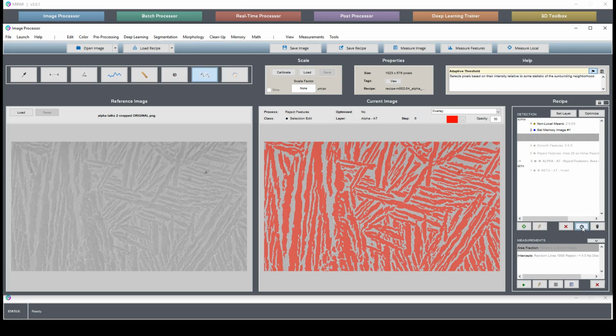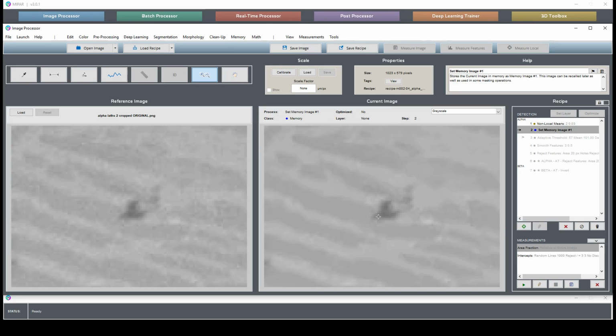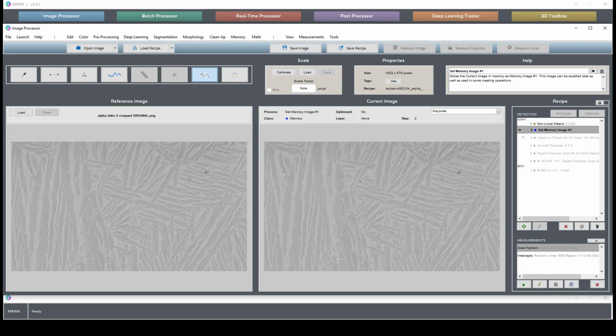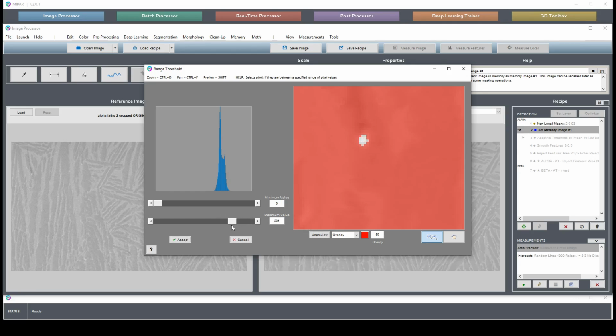So to accomplish this, we'll start with our noise reduced image and select these dark and bright features. The simplest way to do that here, because we want both dark and bright, is to do a range threshold where I select all the stuff in the middle and then just invert. It takes less processing time to do that one range threshold rather than a bright threshold added to a dark threshold. Much easier to just invert.